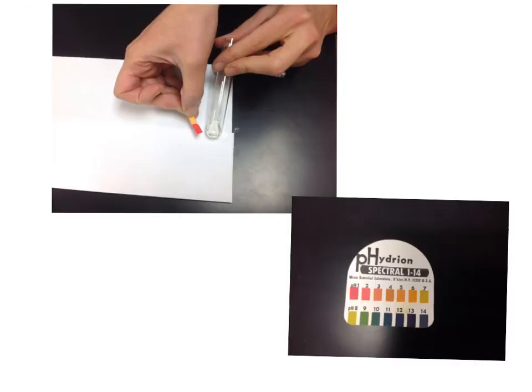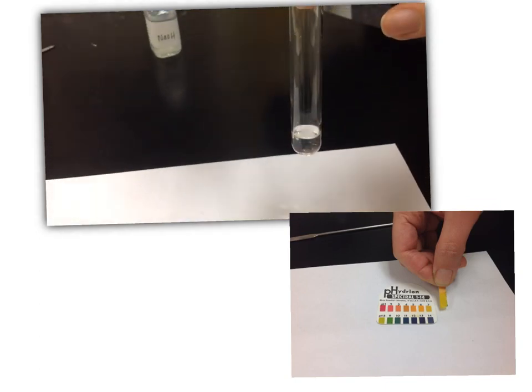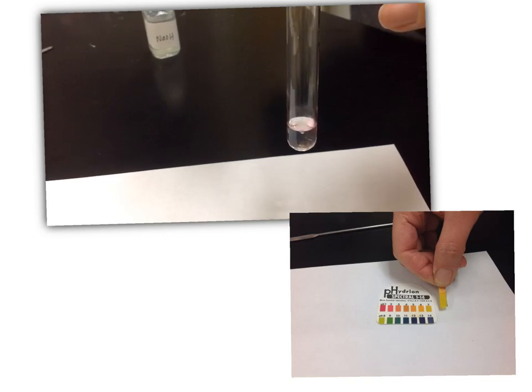For the last neutralization test, we've added 5 drops of the hydrochloric acid into a test tube and have recorded the pH. Look at the pH paper in the above picture and compare it to the scale at the bottom. Record this initial pH of the 5 drops of hydrochloric acid in your data table. We are now dropwise adding sodium hydroxide into the hydrochloric acid.